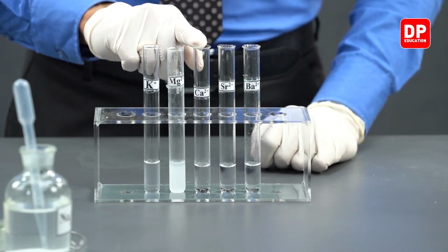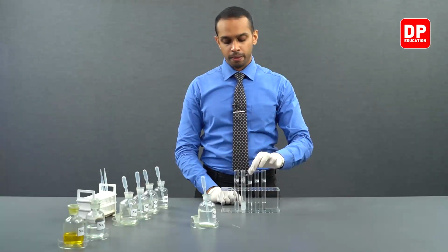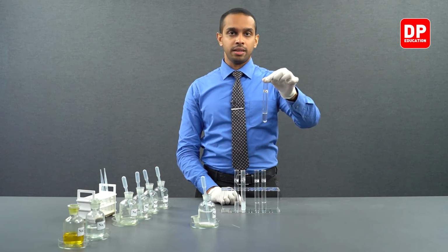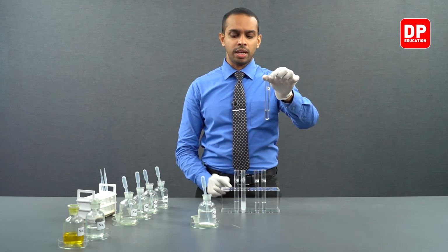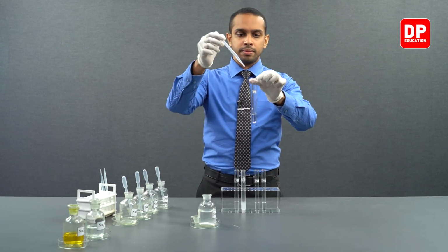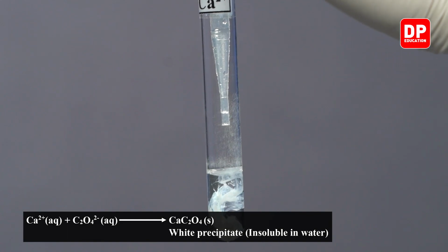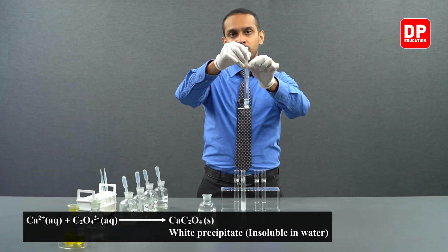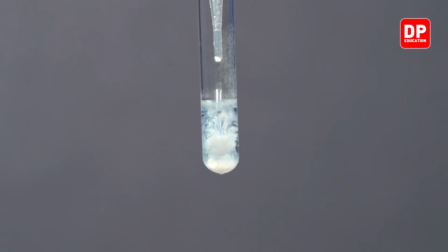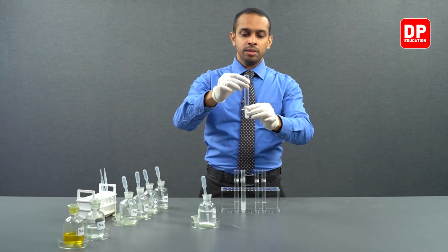We have here our calcium 2+ aqueous ion solution. Let's take this calcium 2+ aqueous ion solution and react it with sodium oxalate. As you can see, when just one drop of oxalate anion solution is added, you can see the formation of a white color precipitate. Let's add a few more drops to see it very clearly.